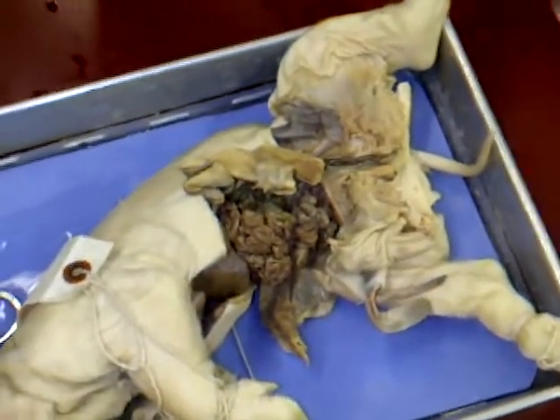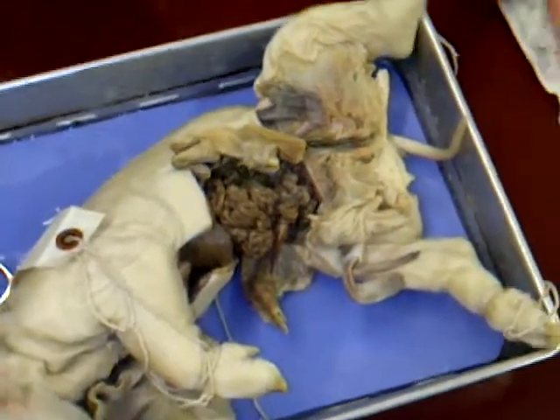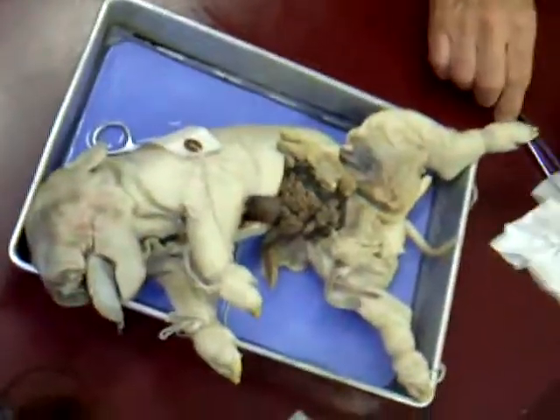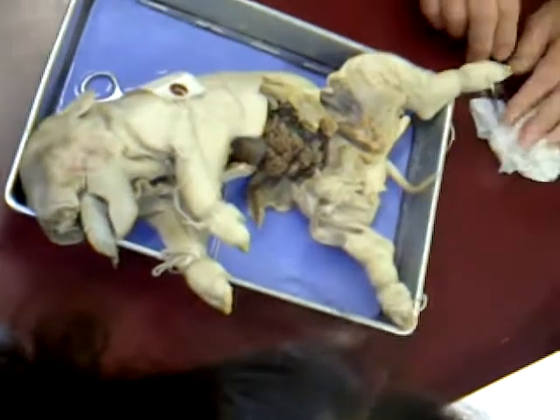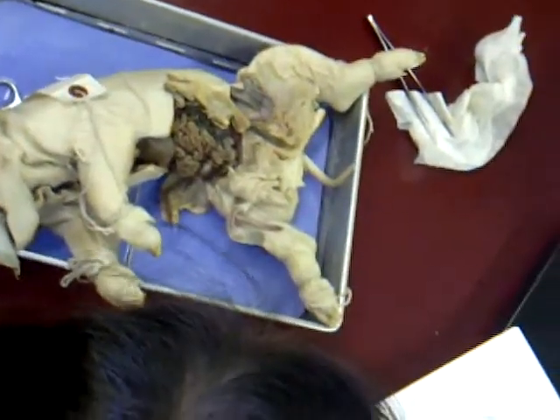As I say, on the gross anatomical level, the female is simpler than the male, which is a little more tortuous. One reason being that in the male, the urinary tract and the reproductive tract are not completely separated. Both sperm and urine come through the urethra. Now we can have our little boy here.